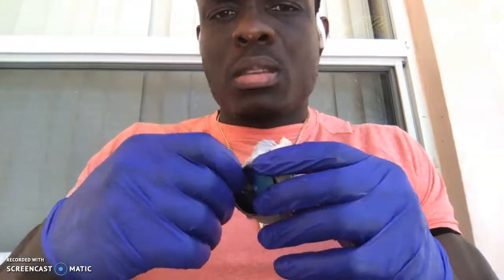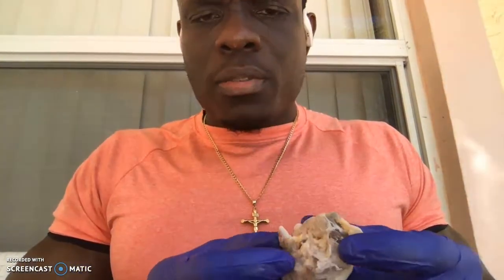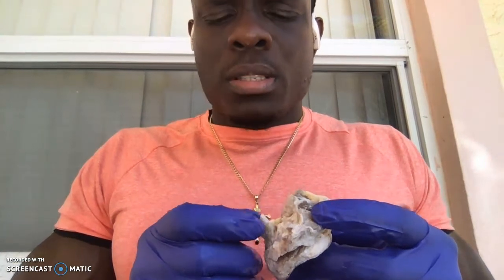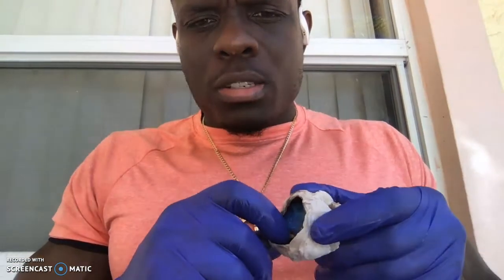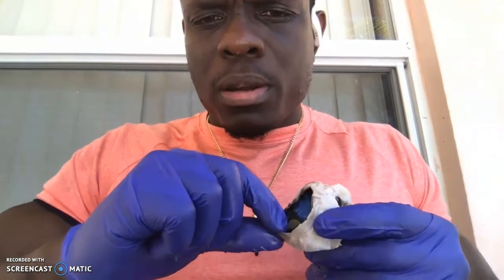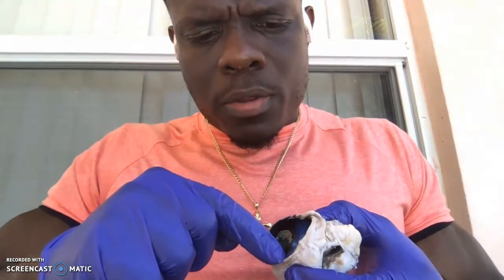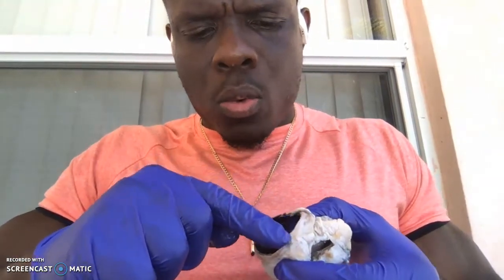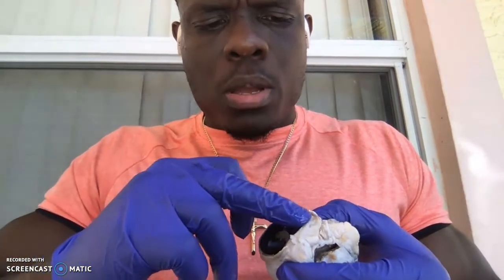And let me mention another major component. So here's our retina. Can't connect anything here because on the back over here you have your optic nerve. So here's the optic nerve over here. This is our retina. So if my retina is right here, that means essentially the choroid is going to be real close by. The black component right over here, that's the choroid. And if I go on the tip part right over here, you're going to see the white structure going around. Essentially, that's the sclera. It's going to start on the back over here and work our way around.